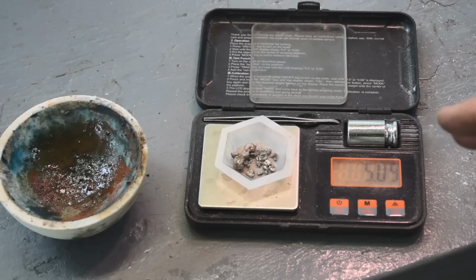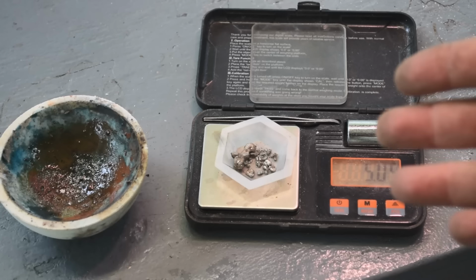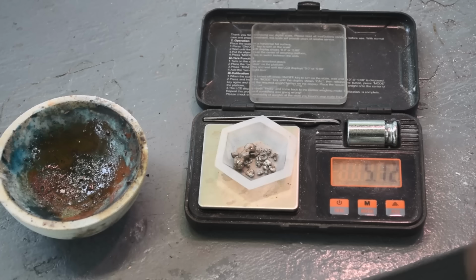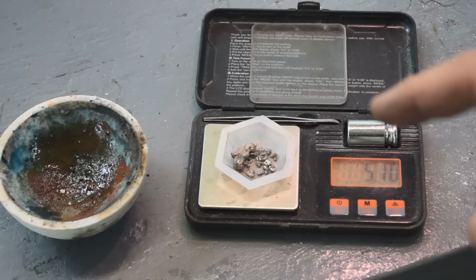I would probably, if I had to do it again, and I will be when I'm doing my rags and filters, get off of there, and my stock pot, I'm going to get a lot of palladium this time because I know there's a lot of palladium. A lot of this palladium is wound up in those two places. So I will do it a little different.